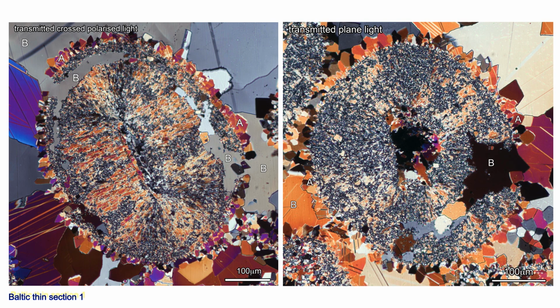A sequence of events that could account for these features is: first, calcite cement A precipitated on the ooid's surfaces and grew into the intergranular pores. It is possible the cavities opened before or during cement A precipitation, providing they were not connected to the intergranular pores where cement B precipitated.